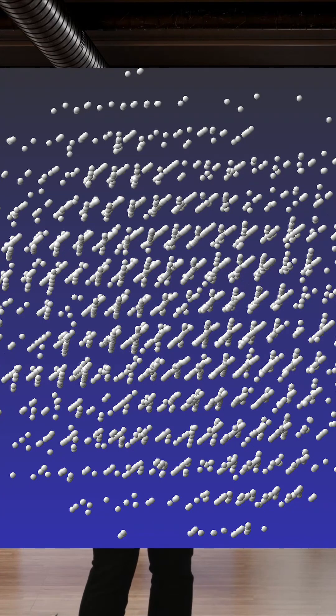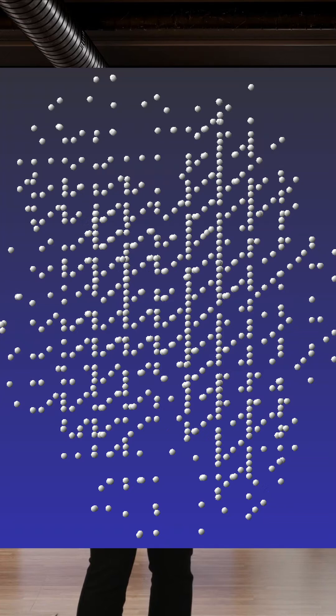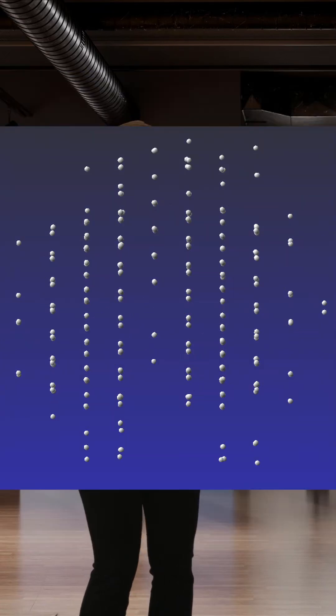Within this plugin, you can also diagnose various features of your sample. So if you see something like this, or this, or even this, you probably have a twin.